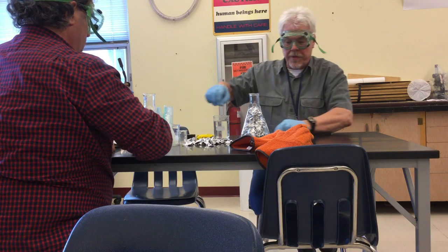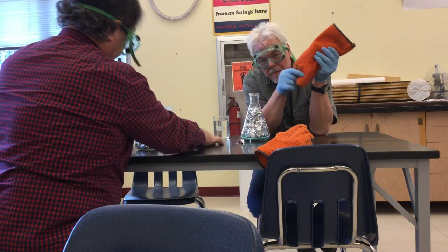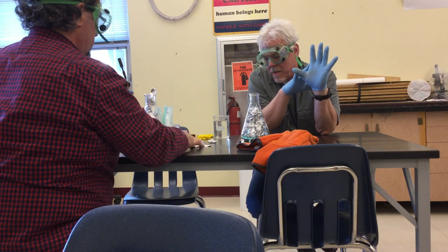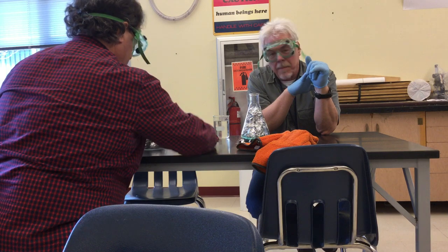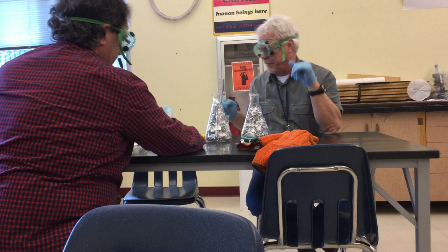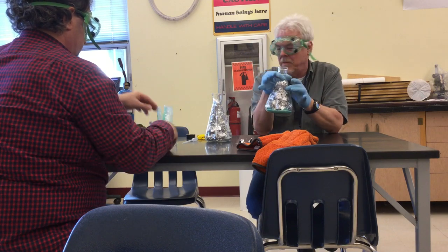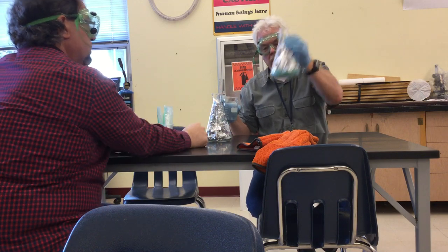It is very exothermic, so it's gonna get hot. Mr. Pole's gonna be using these gloves. Unfortunately, these are the gloves I have to use. Don't want any chemical burns, but it's gonna be hot, so you guys need to work fast. So we have our magic science hydrogen-making crystals, we have our aluminum, and there is one more ingredient — plain old water.